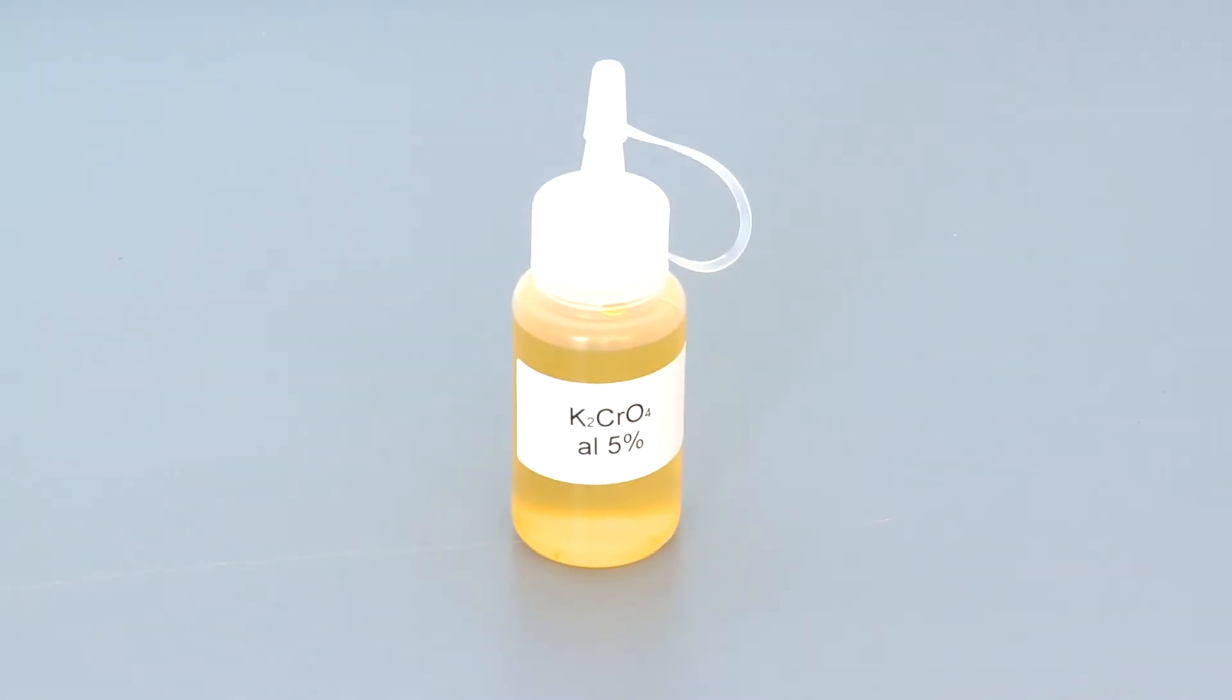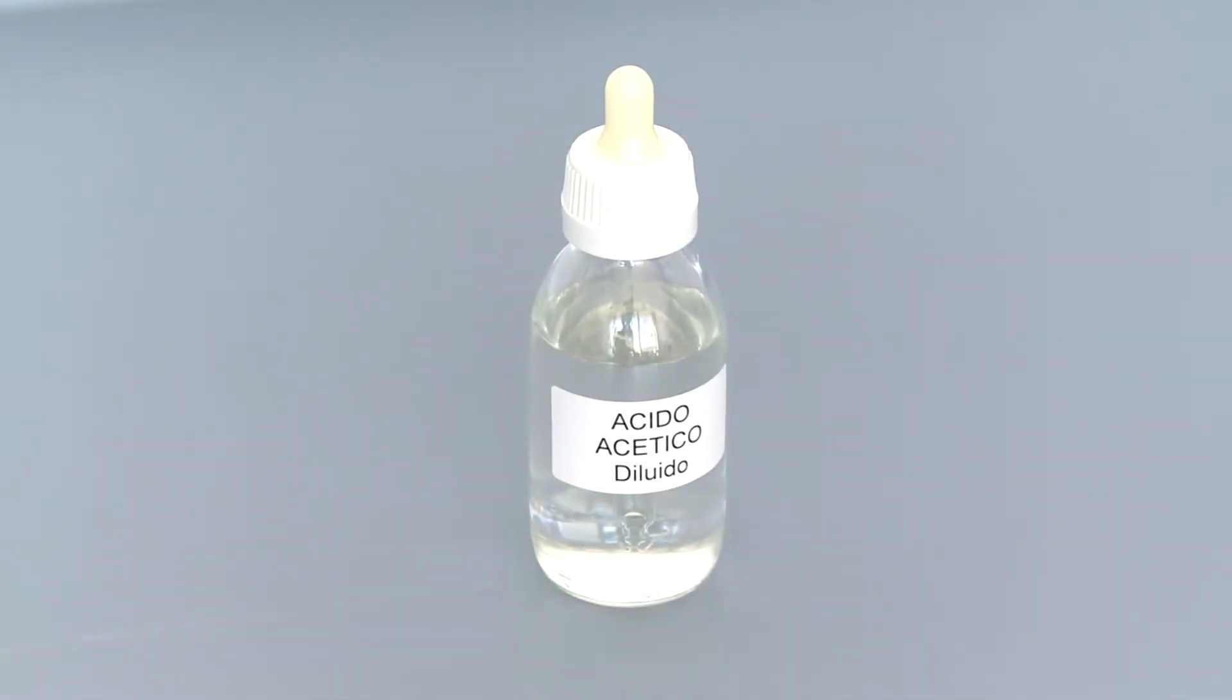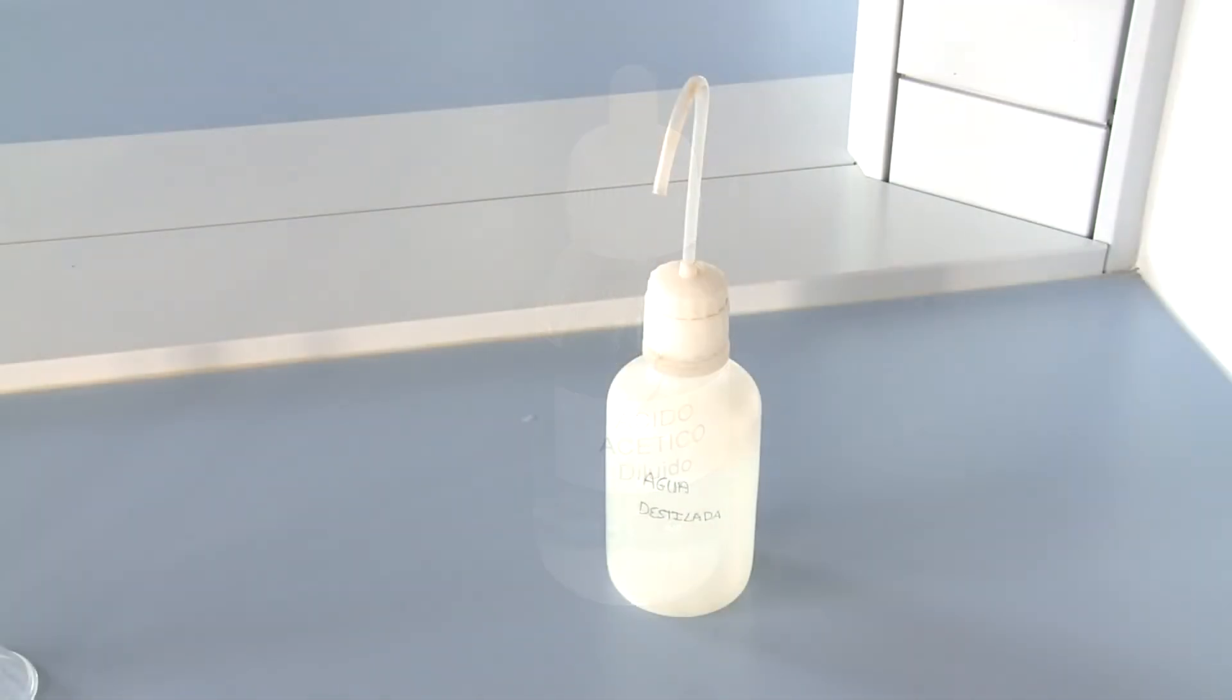Potassium chromate, acetic acid, sodium bicarbonate, distilled water.